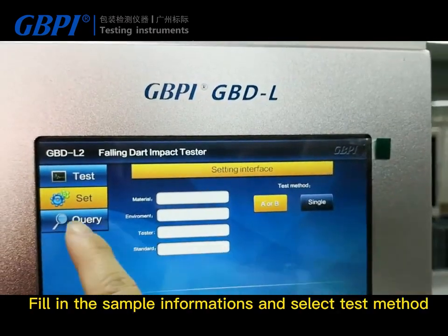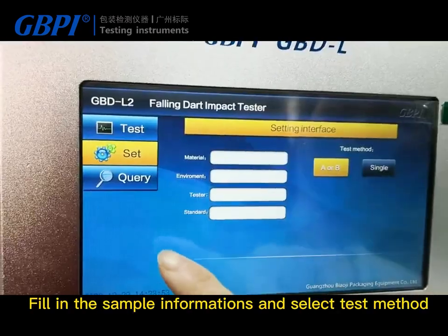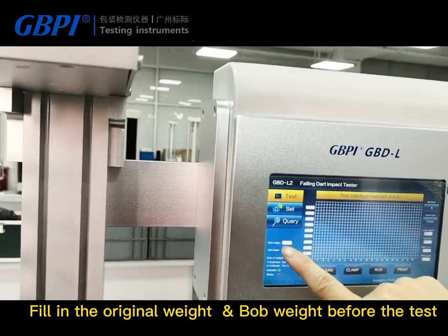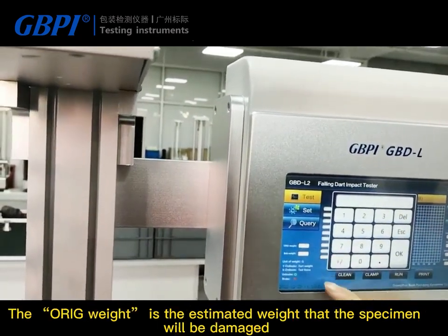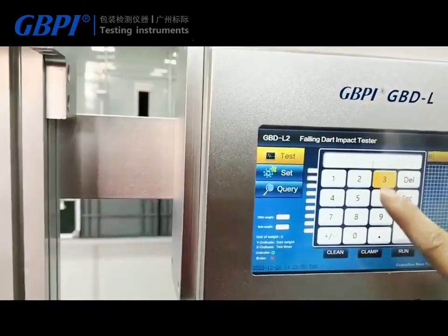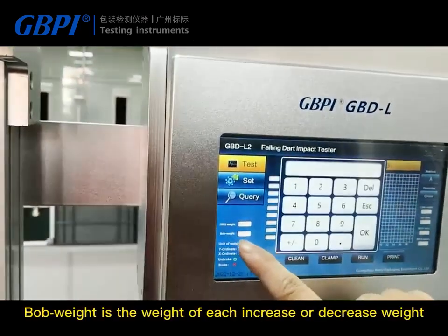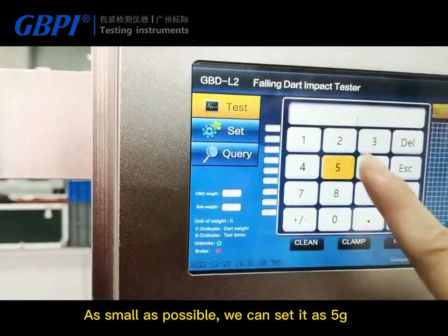Fill in the sample information and select the test method. Fill in the original weight and bob weight before the test. The original weight is the estimated weight at which the specimen will be damaged — for example, 350 grams. The bob weight is the weight of each increase or decrease step; set it as small as possible, such as 5 grams.